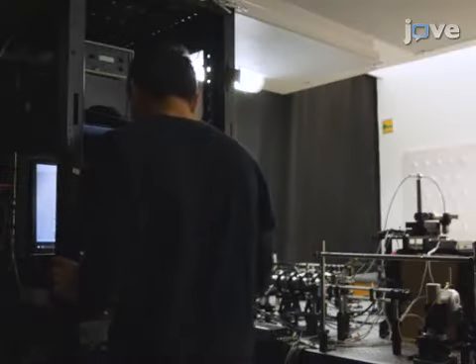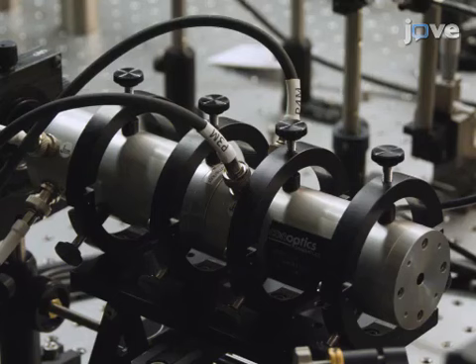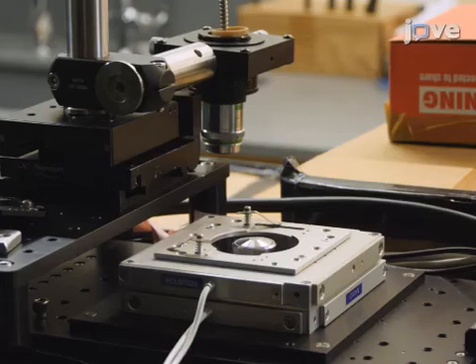Prepare the apparatus on an optical table. This setup is ready for calibration. Key components include a 488 nanometer solid-state laser, 2 electro-optic deflectors that are along the beam's path, a tunable acoustic gradient lens, and a sample stage with micro and nano positioners.